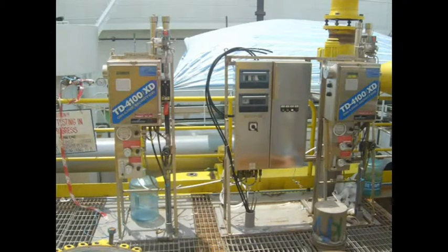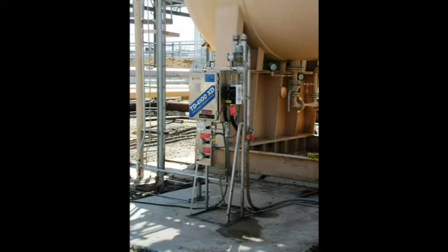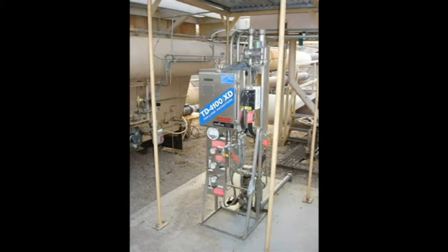This presentation illustrates the reason for the bubble trap and the auto valve. Note that other manufacturers do not offer either device as standard in order to show a lower price. The end user then suffers from the lack of proper equipment and setup.